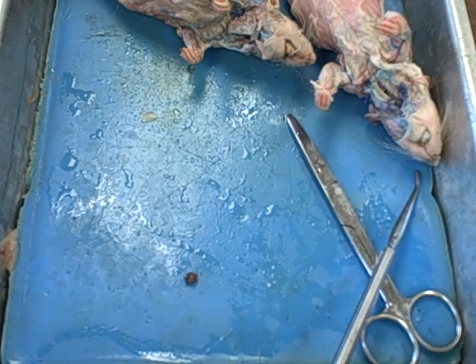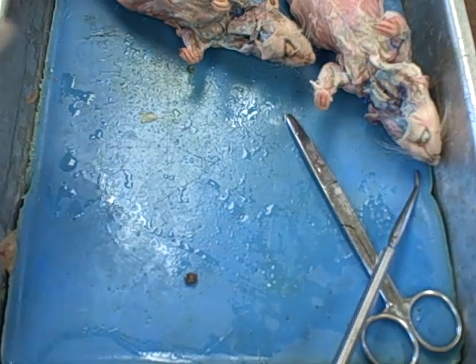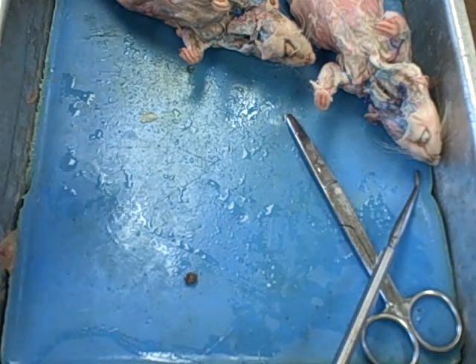So make sure that you come in during open lab times and use your lab time wisely to learn these features on the actual rats. Also, they don't necessarily look the same rat to rat, so that's just the warning before we go through these. On the other hand, this is probably your best study material outside of class. So we'll start with external features.